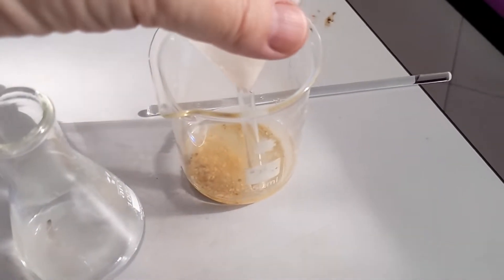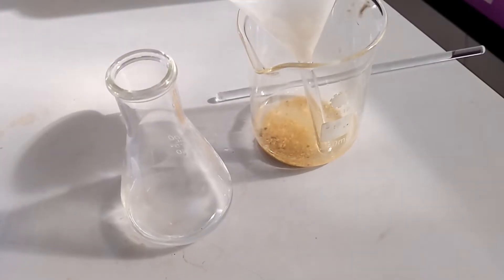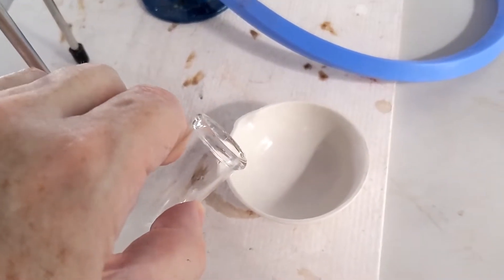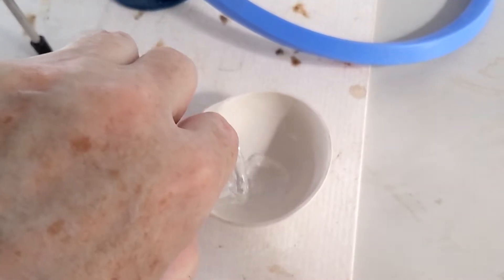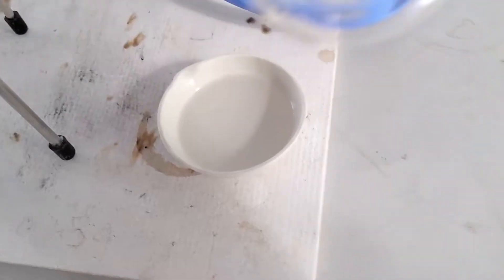Well the next stage is to try and get the salt back. We do that by taking the filtrate and pouring into an evaporating basin. Remember not to overfill.